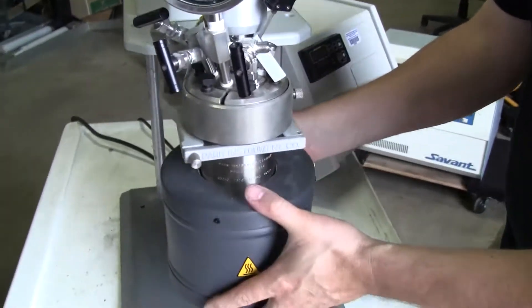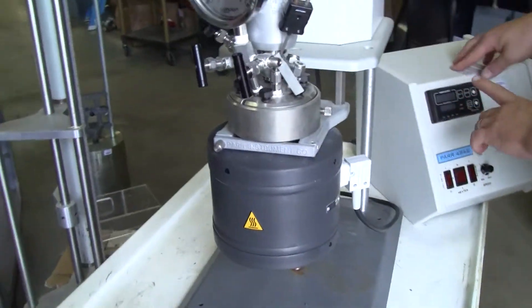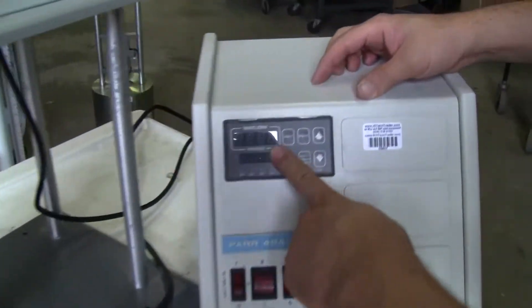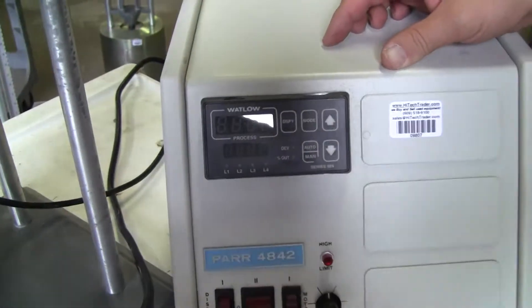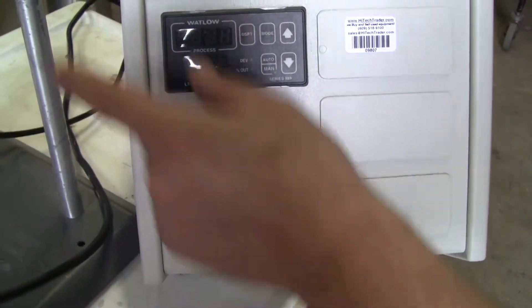The heater then comes up. The controller controls the temperature of the heater and the RPMs of the motor.